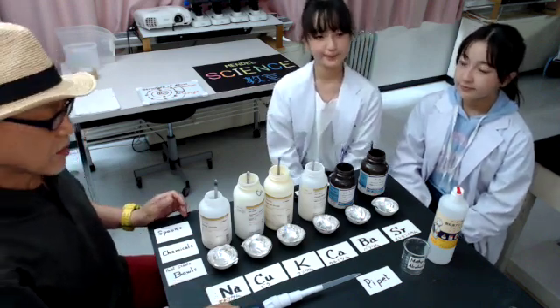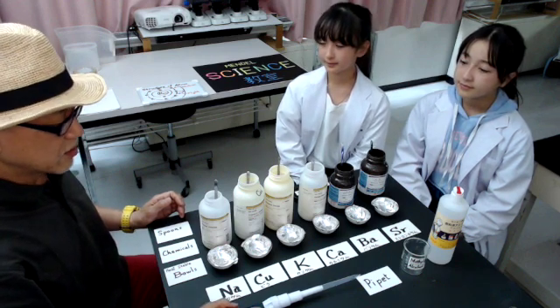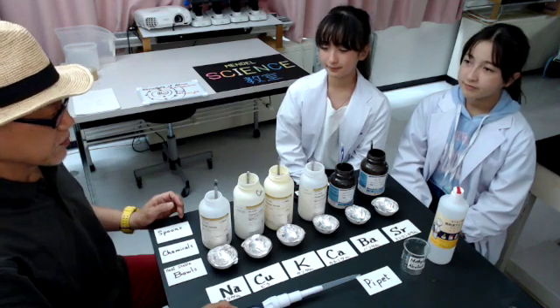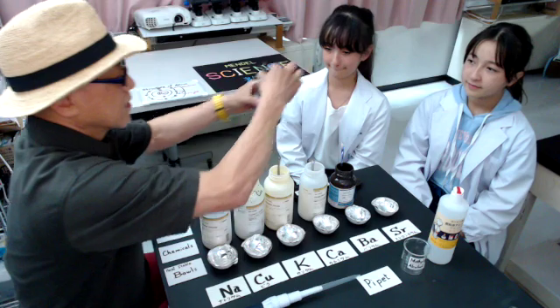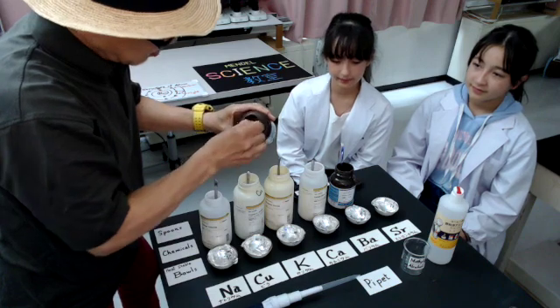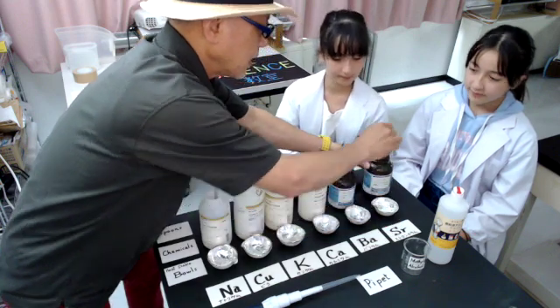So from now, I'm trying to put these chemicals in the flame to observe the flame reaction. To each bowl, one spoon of chemical will be adequate.